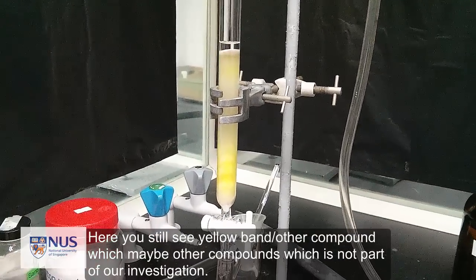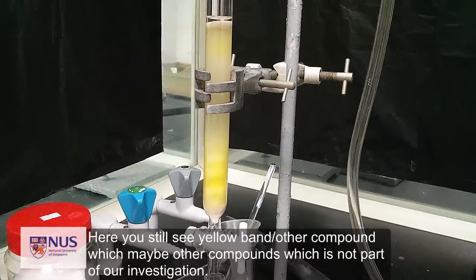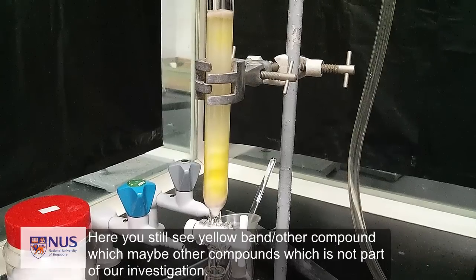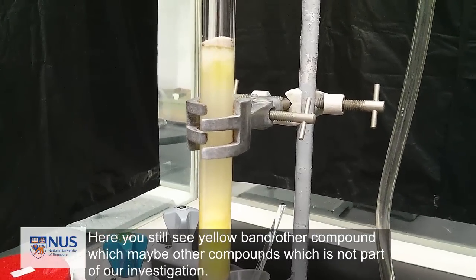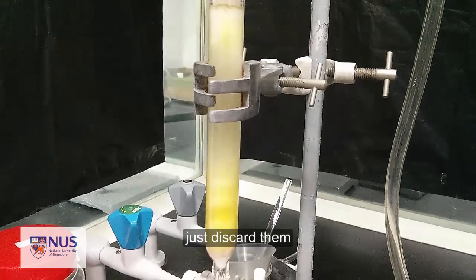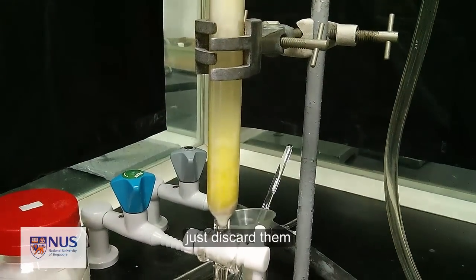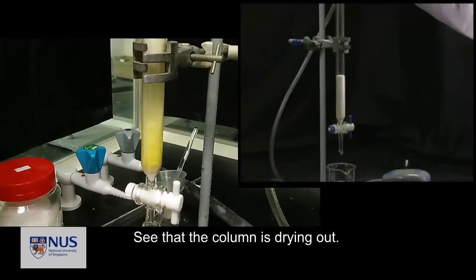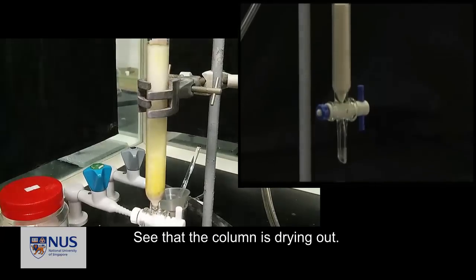Here you still see some yellow liquid which may contain other compounds, which is not part of our investigation. So you can just discard them. You see that the column is drying out? That's good.